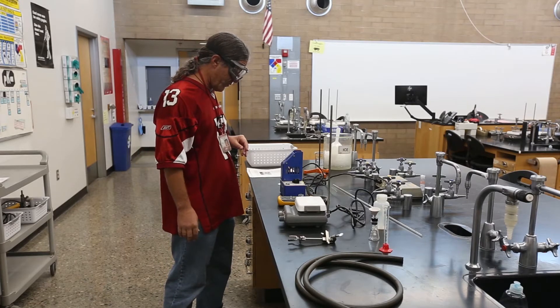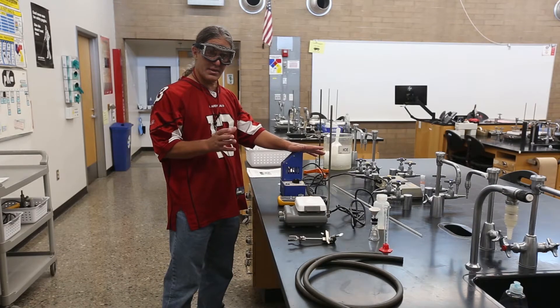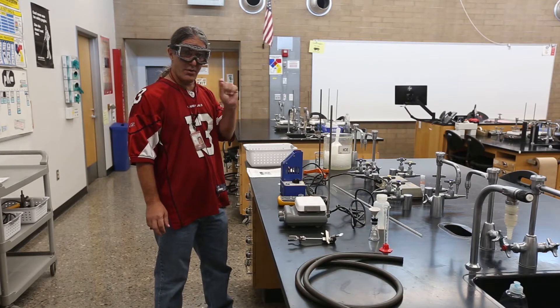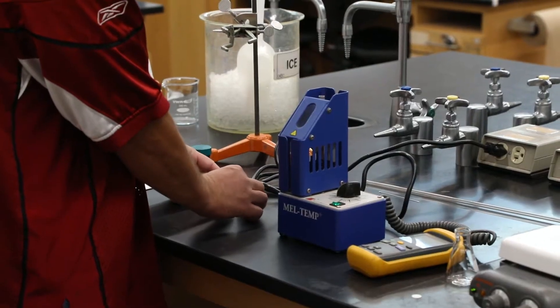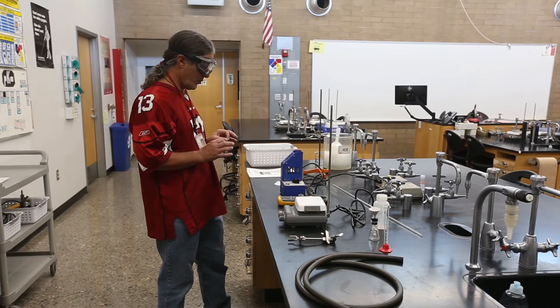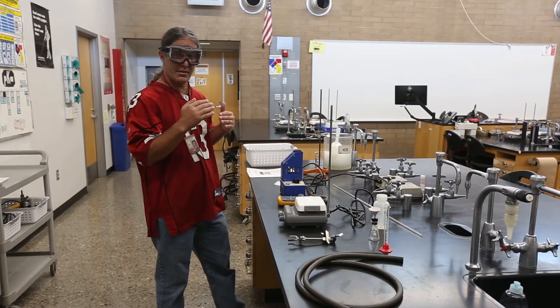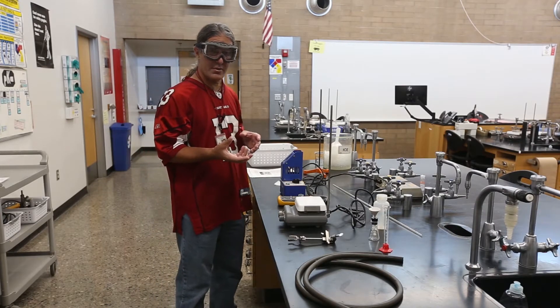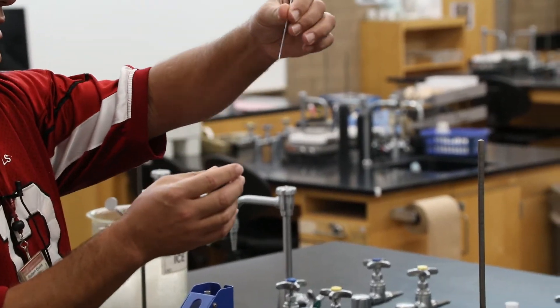We're going to take a melting point of our initial mixture to see how contaminated it is. A pure compound has a reproducible sharp melting point, which indicates good purity. This sample is all powdery, not the nicest-looking crystals — nice crystals are probably pure, powders could be either. We'll take an initial melting point to see how different it is from the pure substance's literature value.